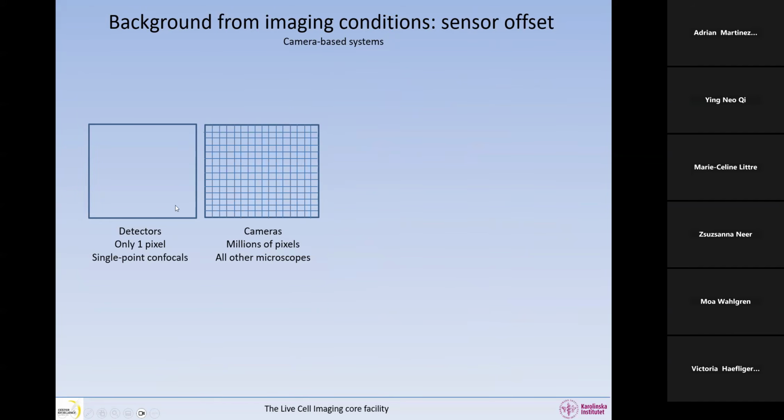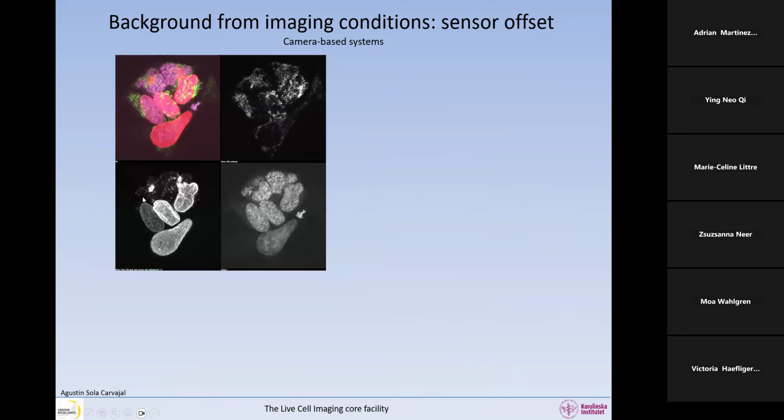So now if we are talking about cameras instead, we also have a sensor offset, which may create some background from the imaging conditions. In this image, for example, we can see that it's a composite image of 3, and here we have the overlay. And so they are very well detected. And if we look here in the background at the intensity, we have 105 in this image, 225. So here is quite high background. And here we have 143. It's also quite high. And this is the reason why this is grayish, because we have a high background.